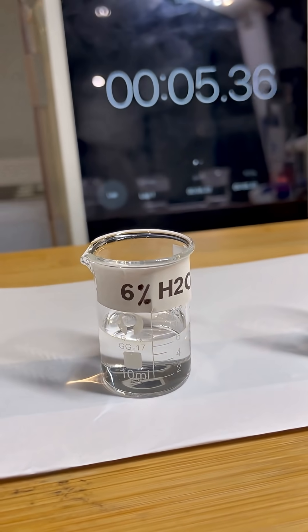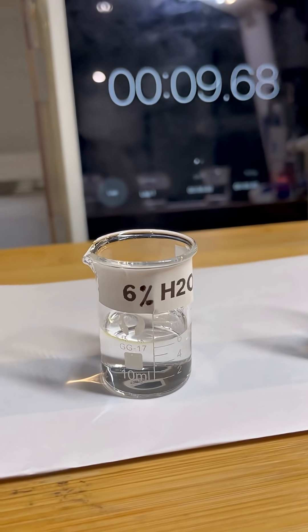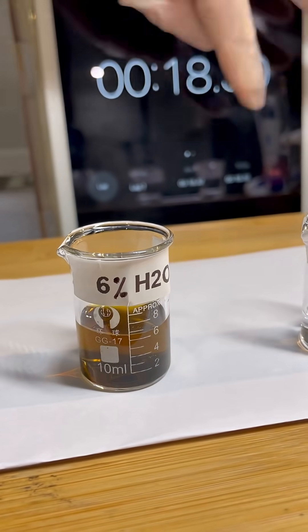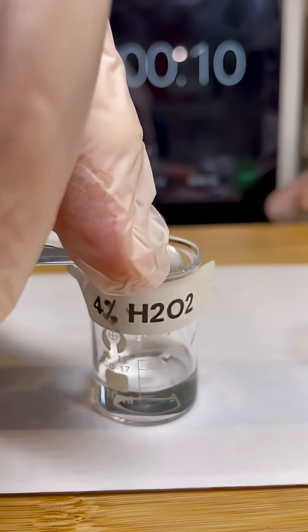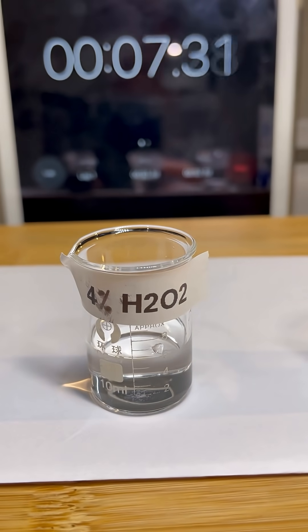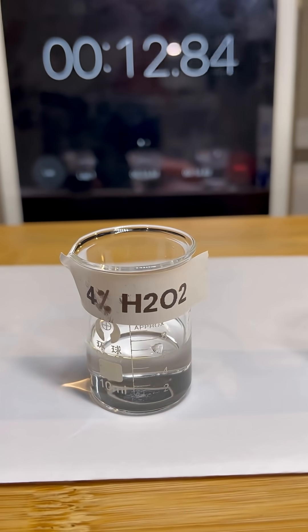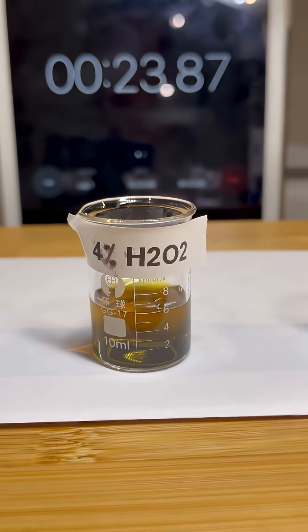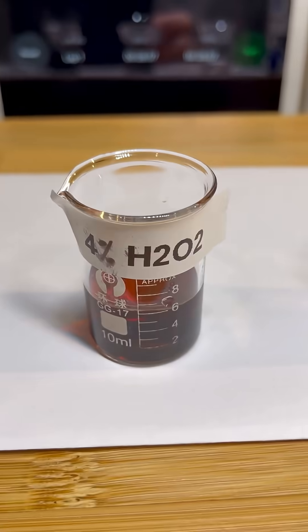The Royal Society of Chemistry has an excellent description of this reaction. Next we add 3 mils of a solution containing soluble starch, sodium ethanoate, potassium iodide and sodium thiosulfate to our 6% peroxide solution. The fresher this solution is the better.